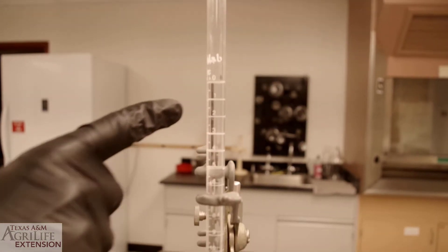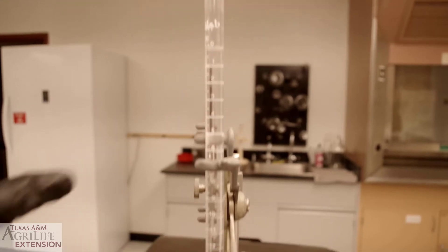Before you begin, record the starting volume of sodium hydroxide in your burette. In our case, the burette is full, so the starting volume is zero.